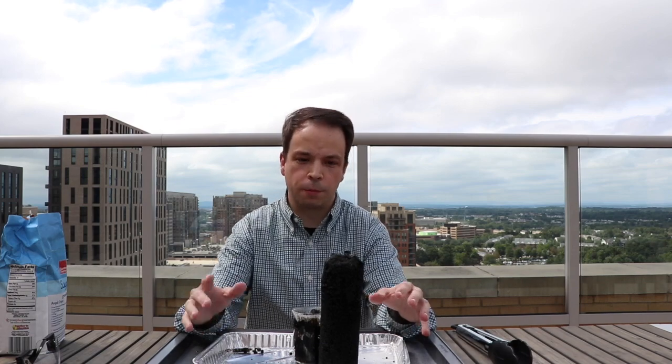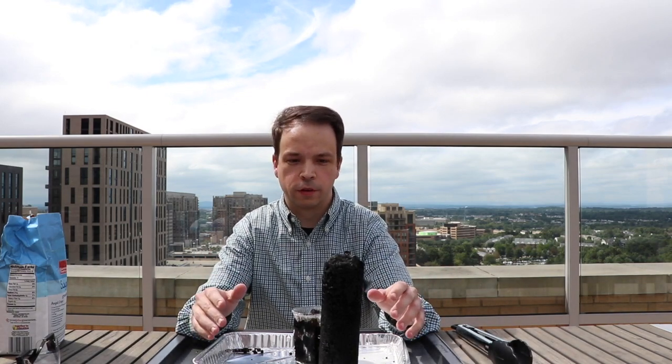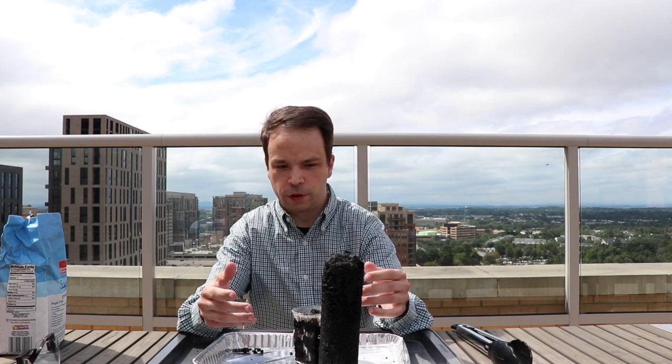So with any chemical reaction, when you're talking about breaking apart bonds, forming new bonds, you're actually forming an entirely new substance. So in this case, we took sugar and we turned it into carbon. You see the tower of carbon here, as well as what you saw steam rising off, which was water vapor coming off, as well as some sulfur dioxide gas, and maybe even a little bit of carbon dioxide as well.